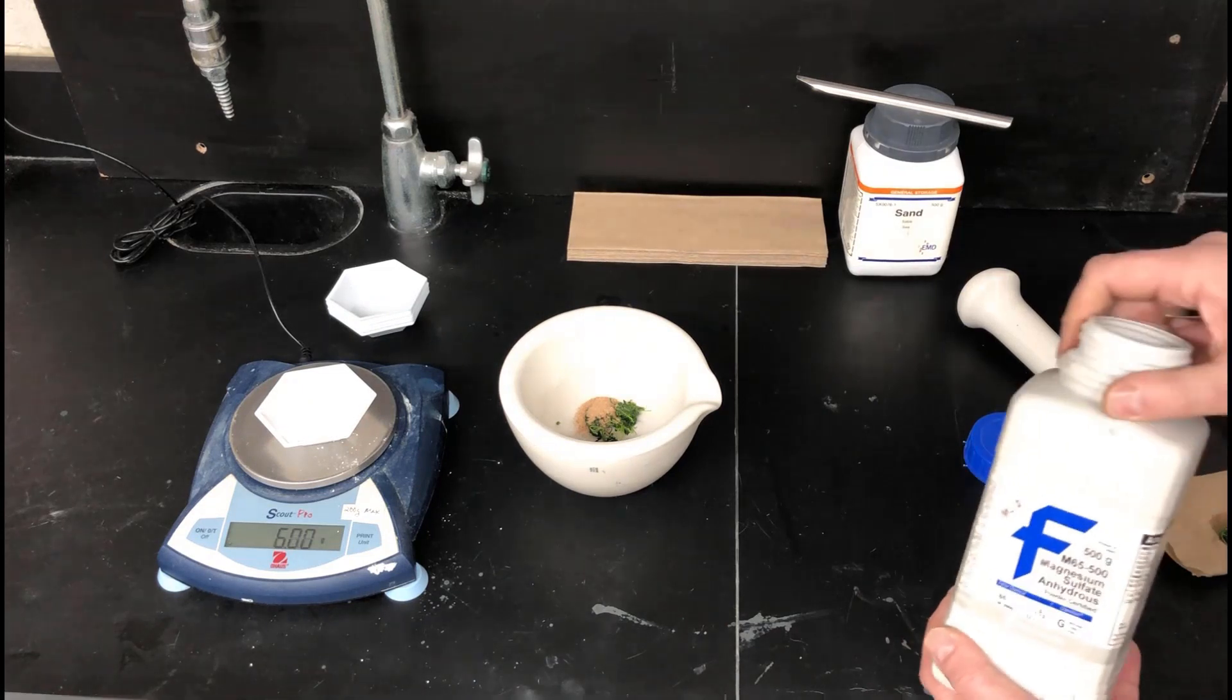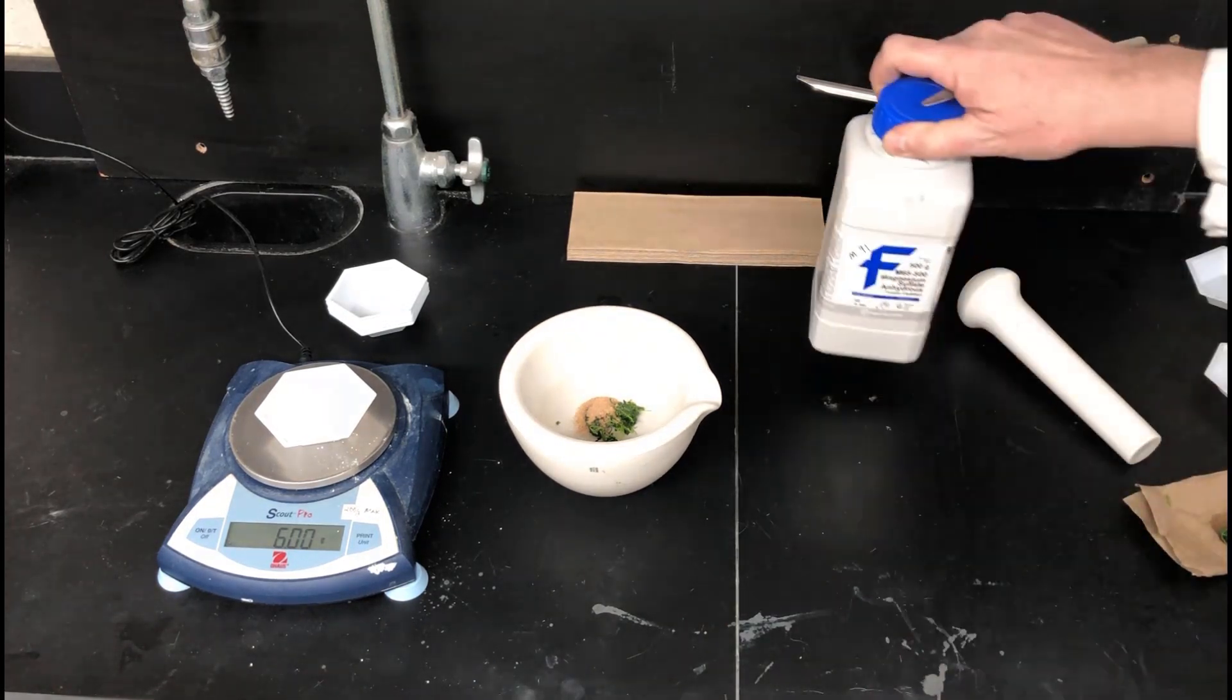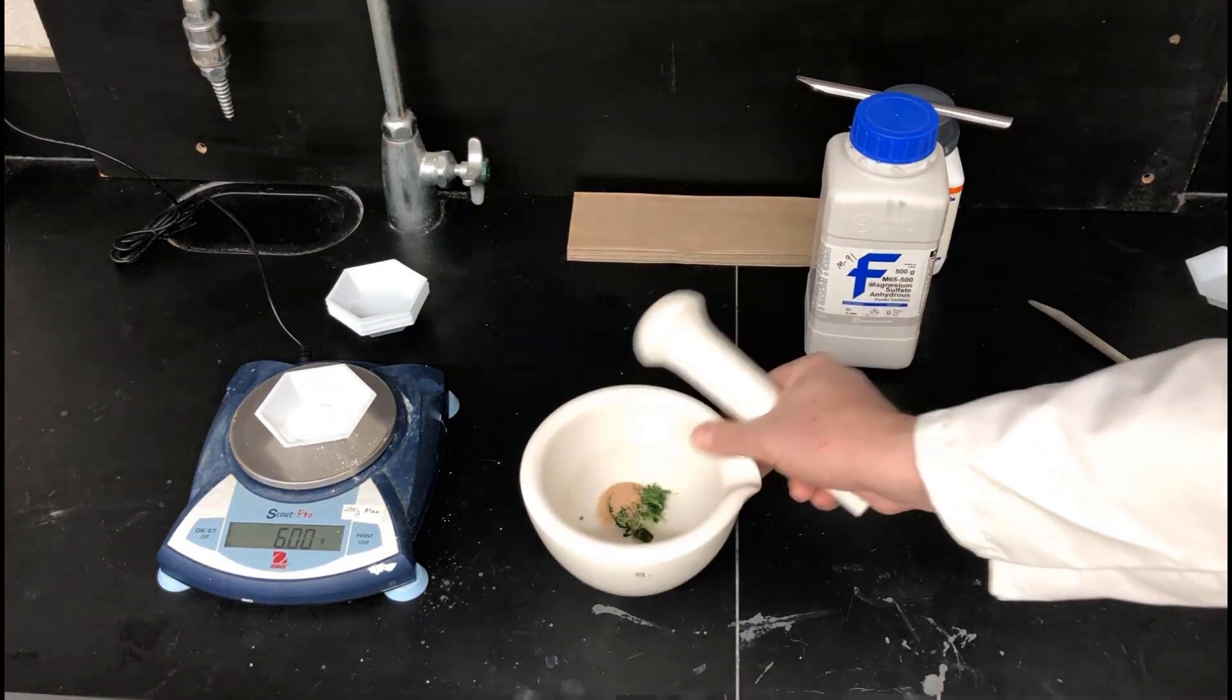Now that's really pretty close to six right there. Okay, add that to the mortar and pestle.